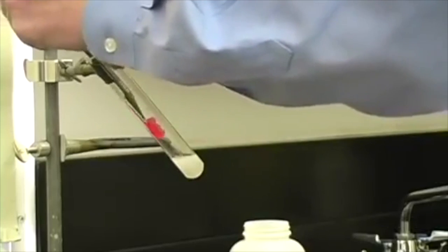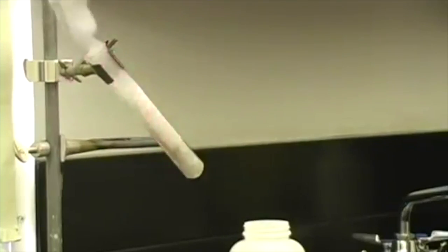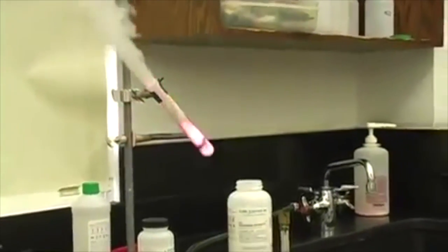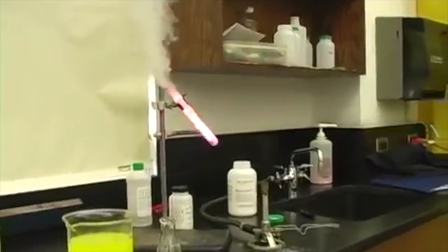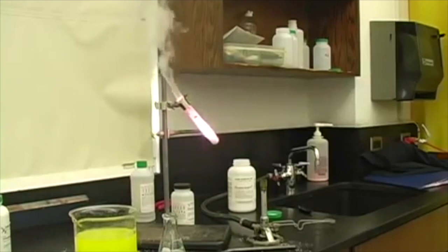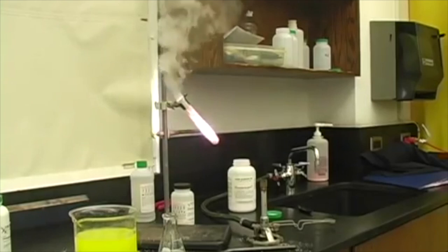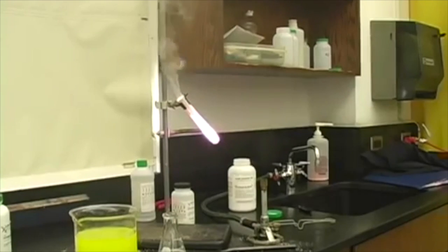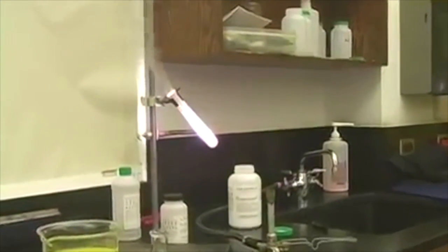For our decomposition reaction, we used a reaction between potassium chlorate and gummy bears. To make this reaction work, we first have to heat the potassium chlorate. When you do this, rapid decomposition of potassium chlorate occurs, producing oxygen. And then when you add a sugary gummy bear to this equation, it causes the sugar inside the gummy bear to oxidize, rapidly combusting the sugar over the course of the experiment. As this happens, purple flames are given off.